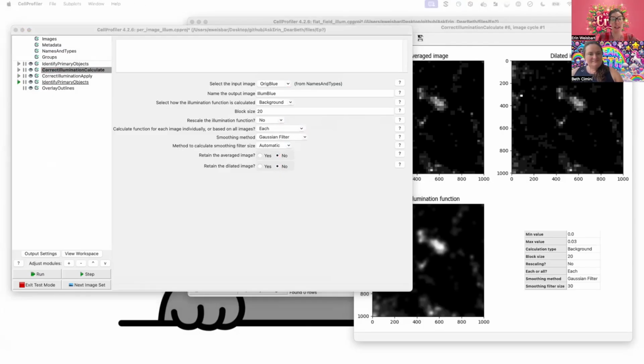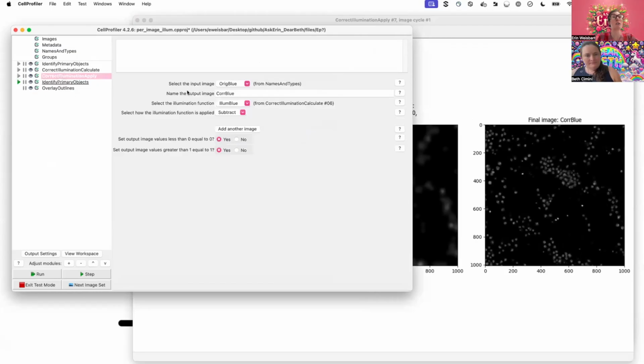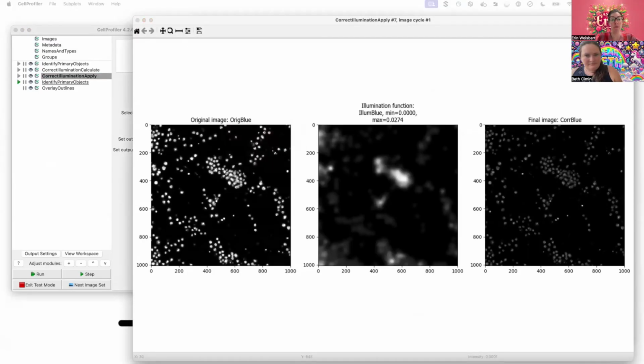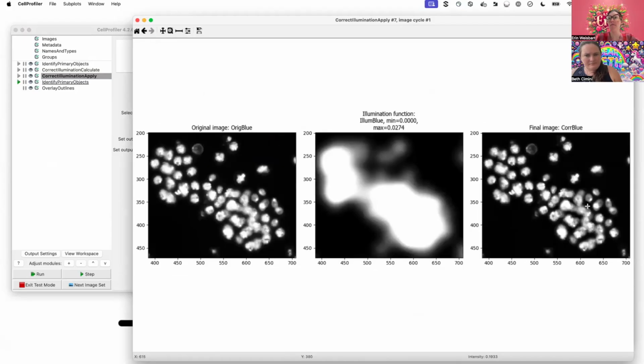And so what we then see is here, I'm applying this. So I am here in my Correct Illumination Apply. The key thing here is I'm selecting the illumination function and I am subtracting it from the image. If you're applying your flat field, you would do a Correct Illumination Apply and you would divide. So perhaps if we blow the signal out a bit, zoom in, do we see by eye? I don't know. I don't see a whole lot of difference. Maybe this is a little crisper than this one. By eye, it might not make that much of a difference.